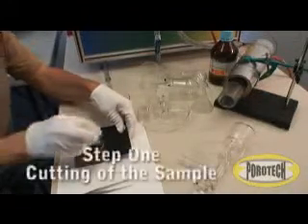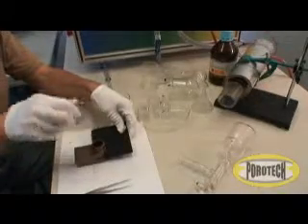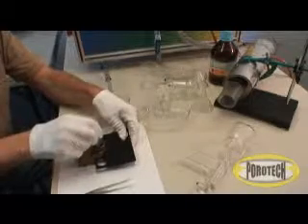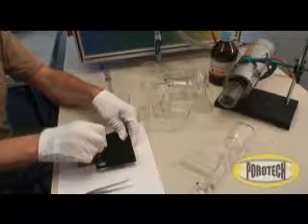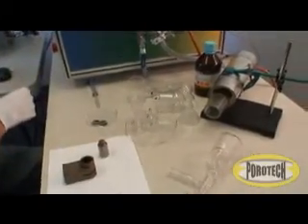Step 1. Cutting of the sample. The material we are using in this case is a gas diffusion layer for hydrogen-oxygen fuel cell. The sample is cut to a 23 mm diameter using a cutting punch.